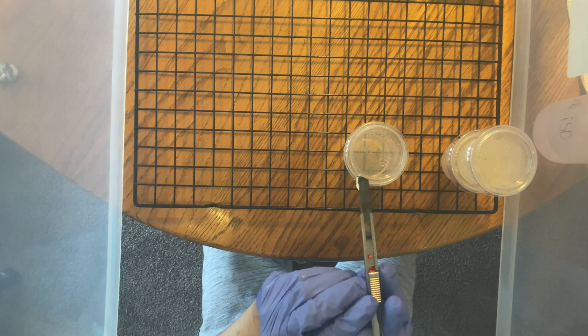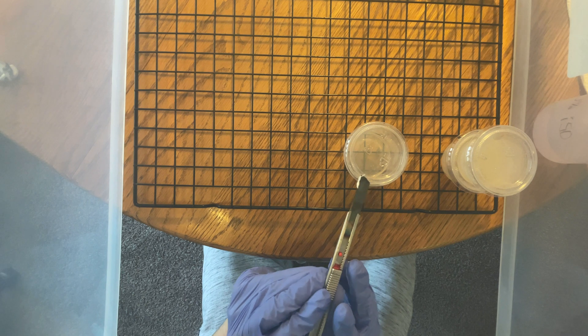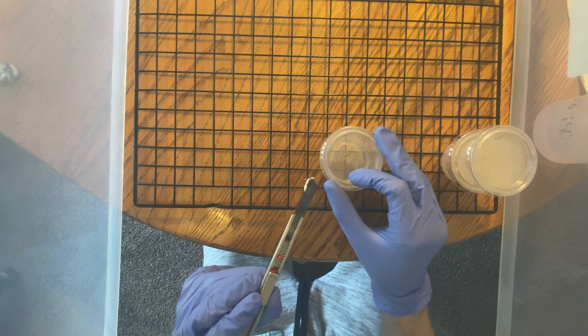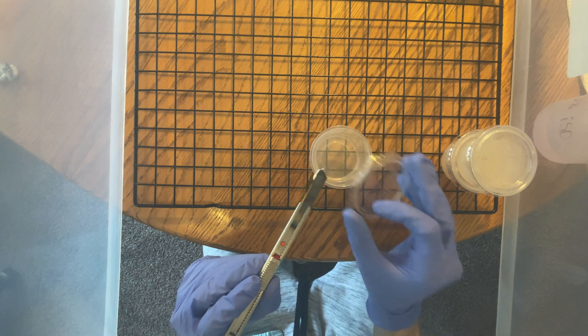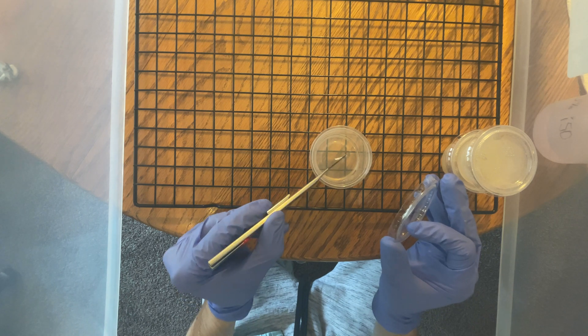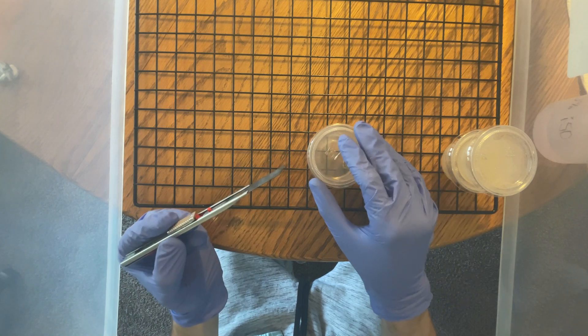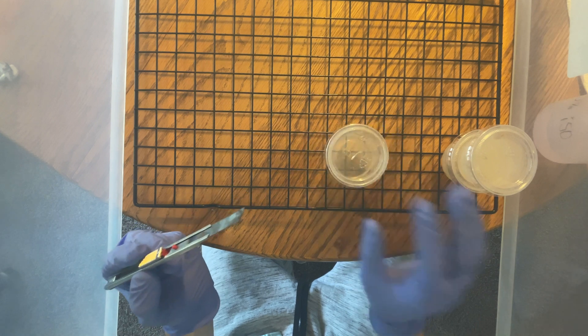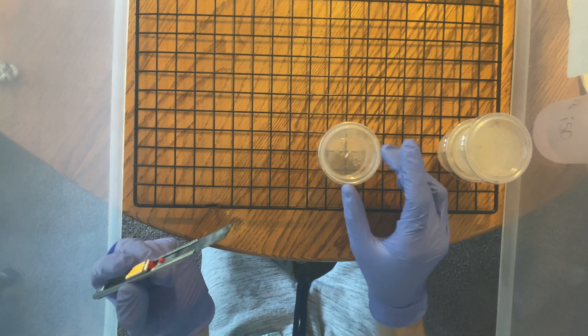I will be doing an update on these so that we can see the progress on how cloning goes off of a single fruit. This is important because while cloning you carry on the genetics of a fruit, it won't necessarily solidify the trait into its genetics.